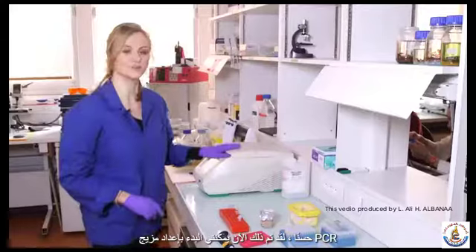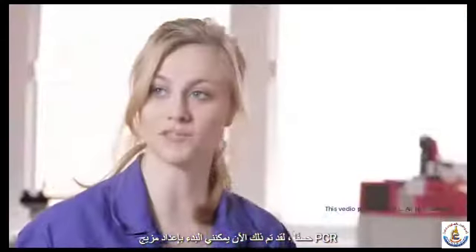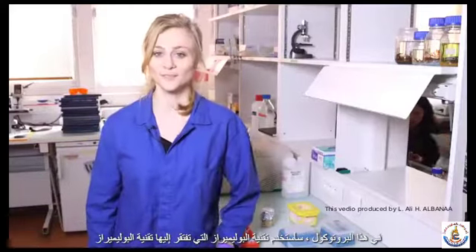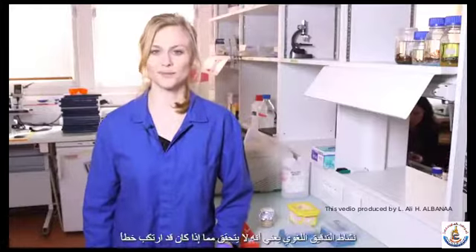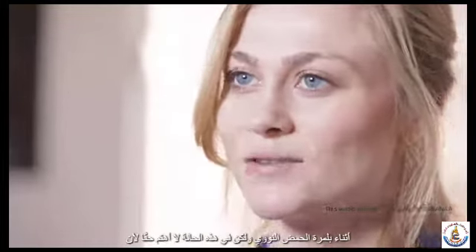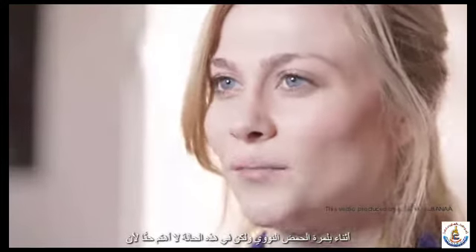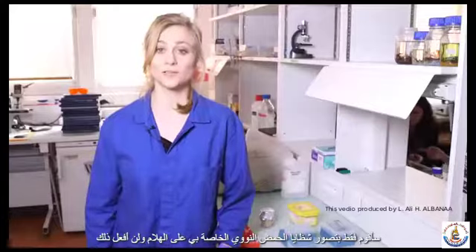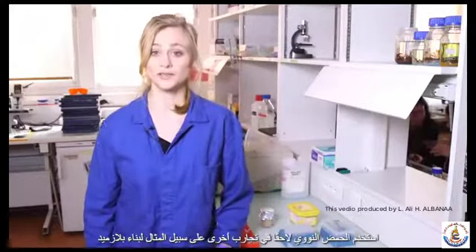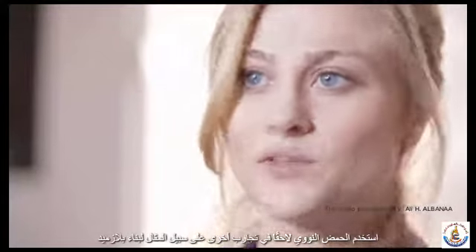Okay, so this is done. Now I can start with the preparation of the PCR mix. So in this protocol I'm going to use a Taq polymerase. This Taq polymerase lacks proofreading activity, meaning that it doesn't check if it made a mistake during the DNA polymerization. But for this case I don't really care, because I'm only going to visualize my DNA fragments on gel, and I'm not going to use the DNA later on in other experiments, for example to construct a plasmid.